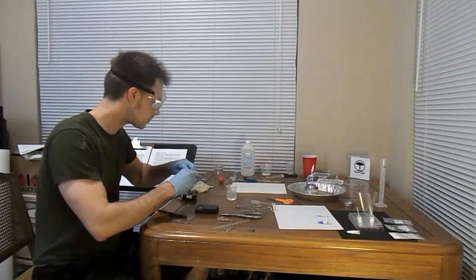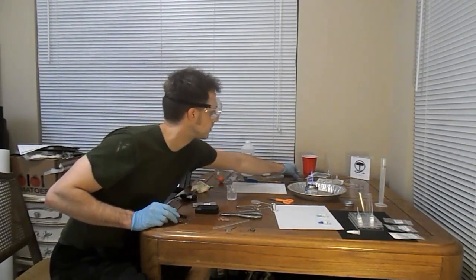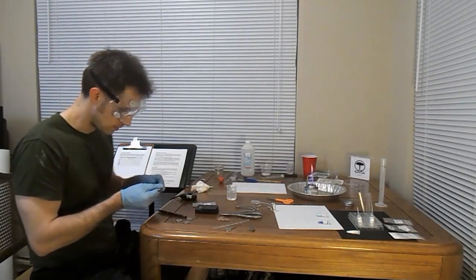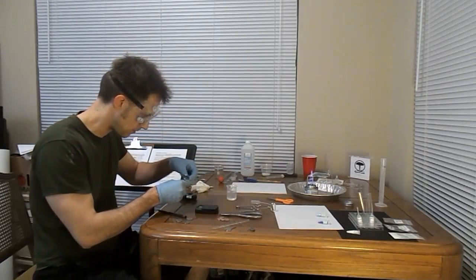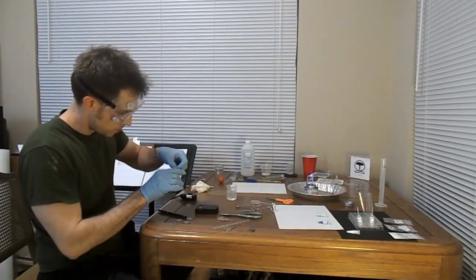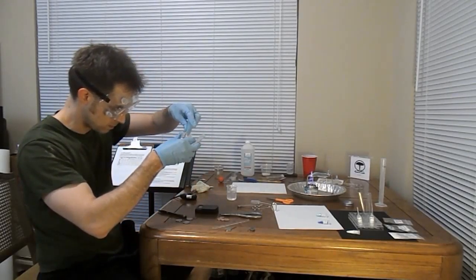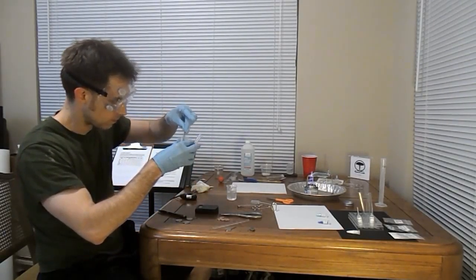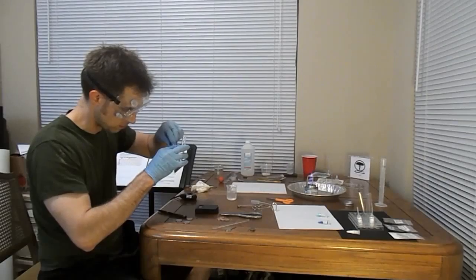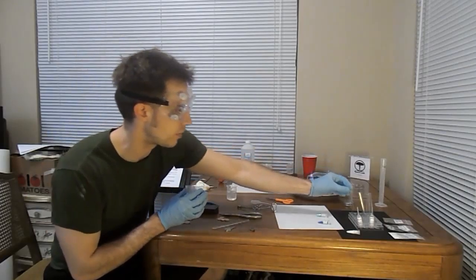Alrighty. So, in the magic of test tube number 1 here, let's get something a little cleaner. Ah, yes, the other end. I love the other end. Not sure how anyone does anything with these lab gloves on. Man, these tweezers are not the best. Let's try the plastic ones. I feel like a monkey in a trap right now.